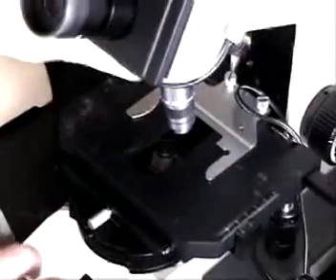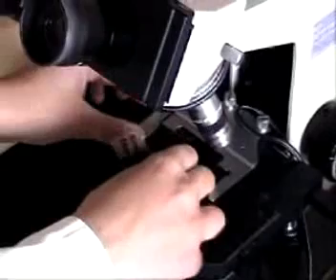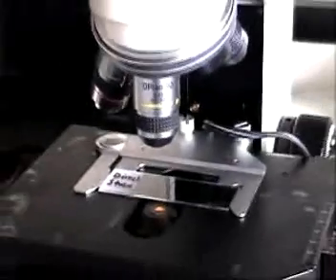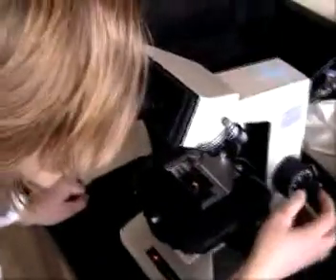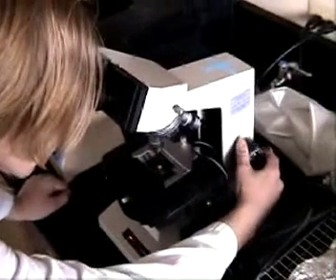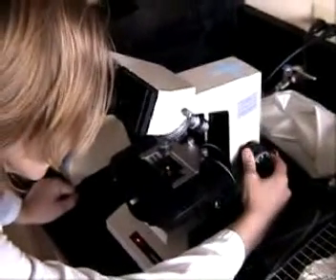Now you can start to look at your slide. Place your slide in the specimen holder and begin by viewing your specimen on the 10x objective lens. The easiest way to focus is to bring your stage as close as possible to the 10x objective lens using your coarse adjustment knob.